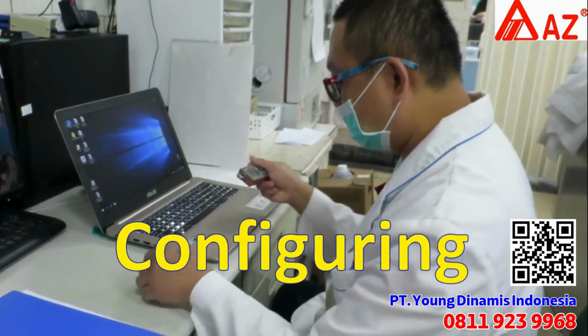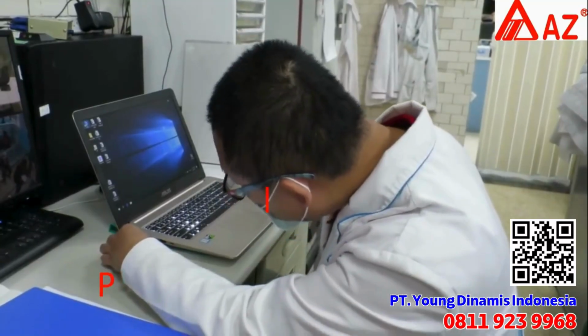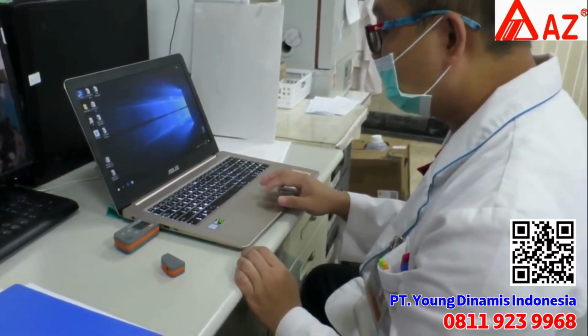PDF logger. Configuring. You don't need to download any drive application. Plug the logger to the USB port. The green LED light will be on when connected.